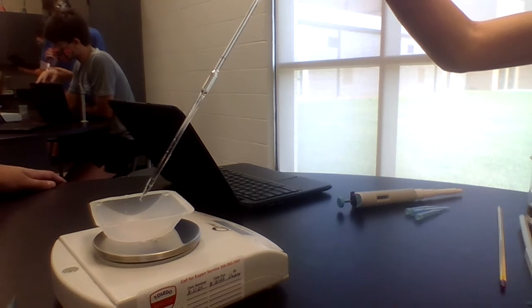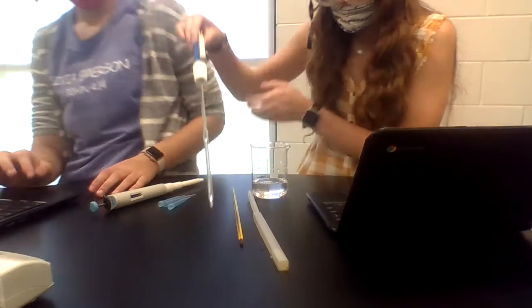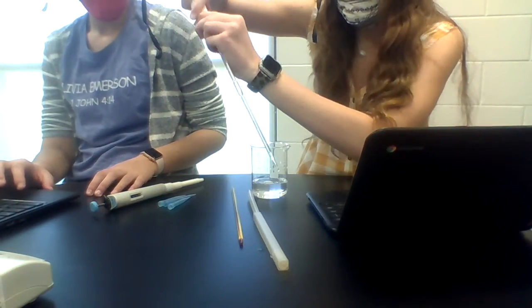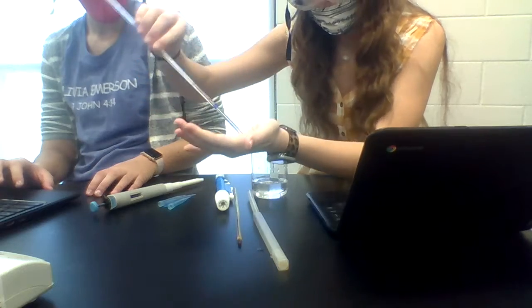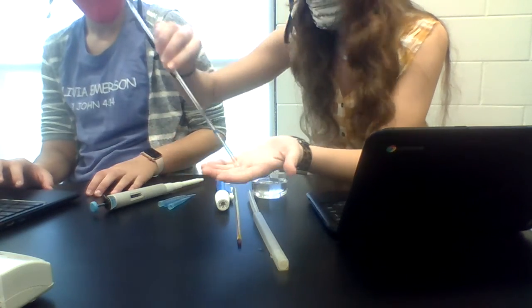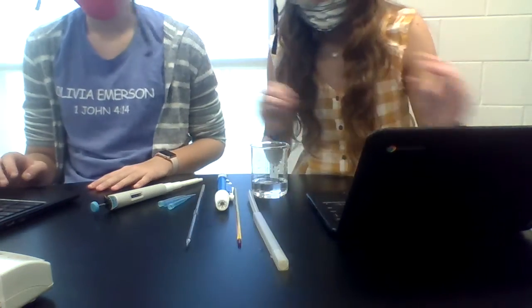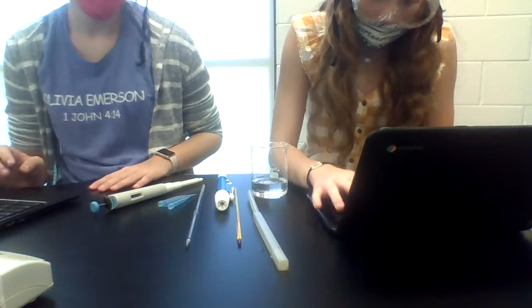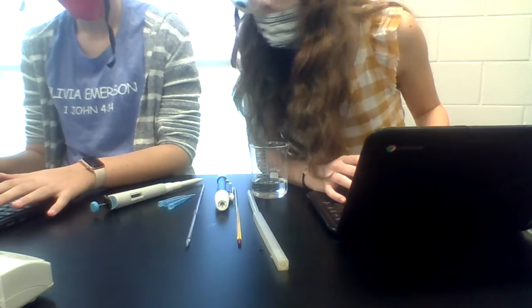Alright. Okay, that's about our 3rd milliliter. Wait, do I need to take this off before laying it down? I think so. Yep. Okay. I don't know if the water will come out now or what, but yes, it will. Okay. Next. We were supposed to get 3 milliliters, and we got close to 2.88.